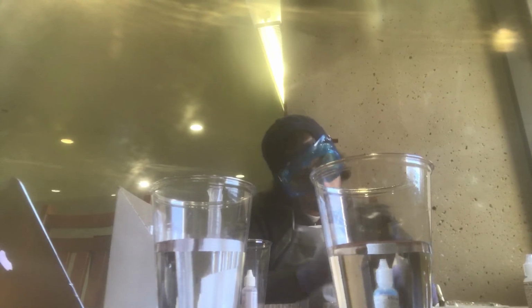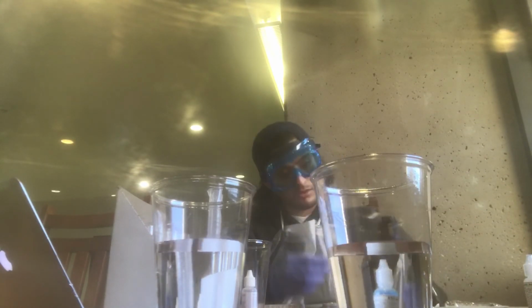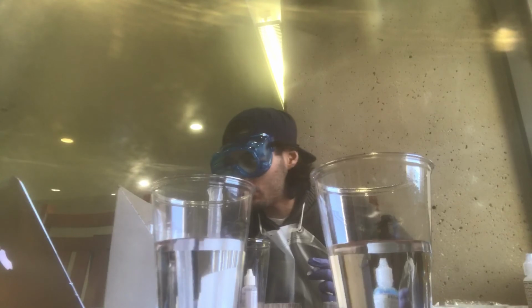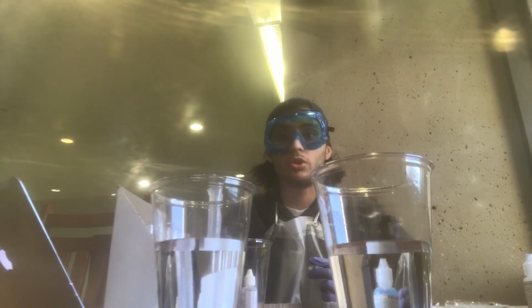We get 0.4. Okay. So 0.4, and we're going to add it to the solution. And let me start the timer, and I will show you the rest of the lab.